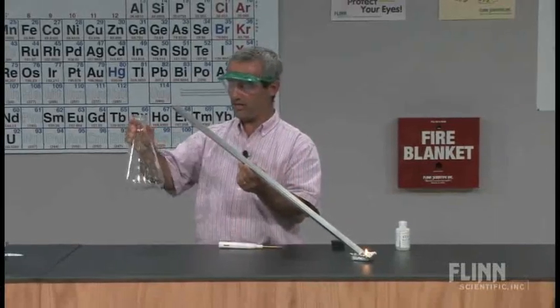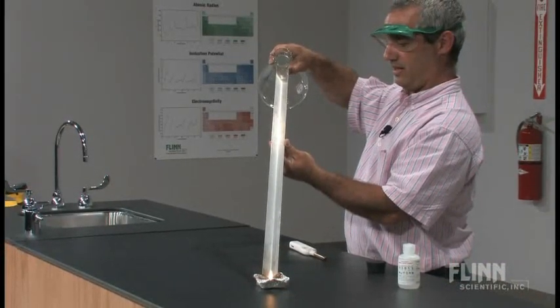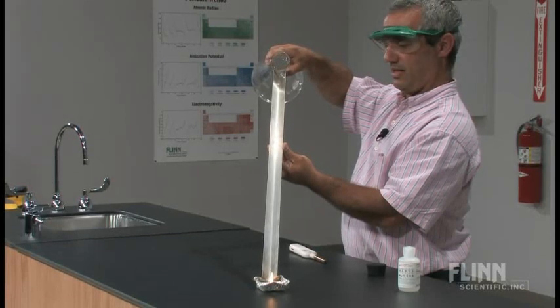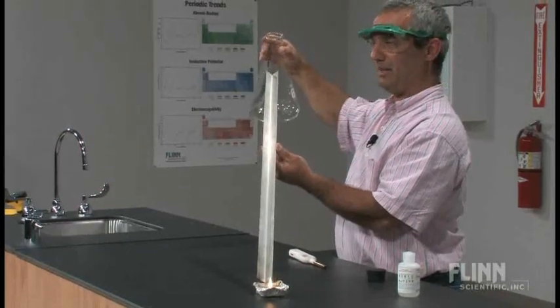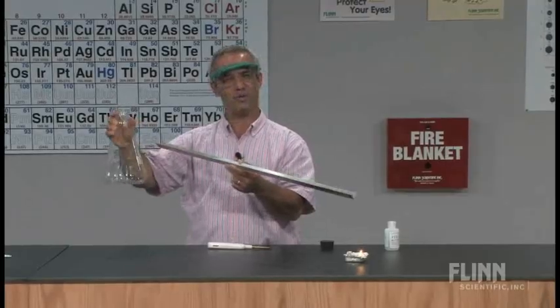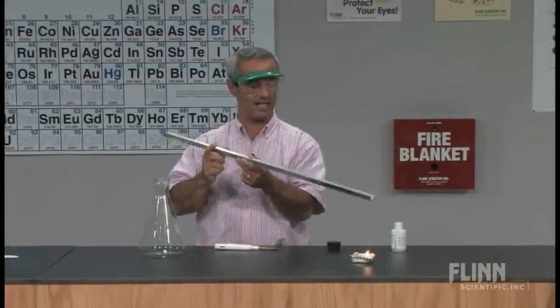Ready? So I'm just getting the vapors, not the liquid, and pouring it down. Whoa! I didn't put out the flame, did I? Well, I really wasn't expecting to. I told you this was a mixture of different hydrocarbons. Of course, they're combustible. So this is a very different effect than if I had poured carbon dioxide down.